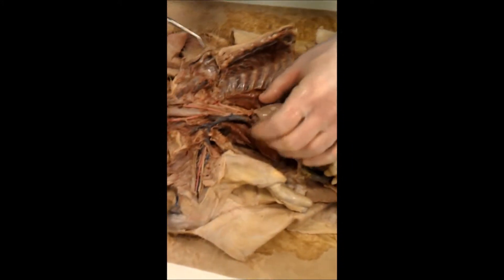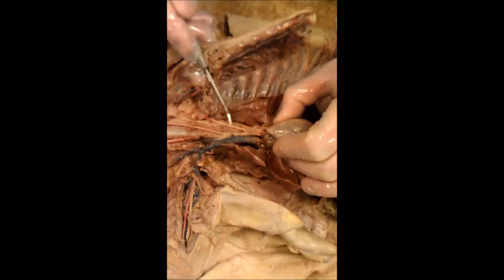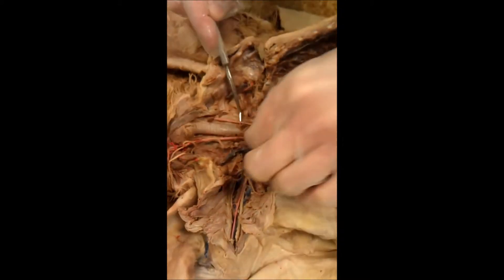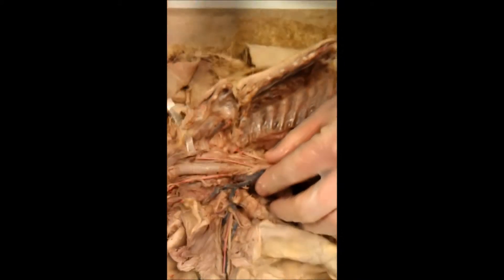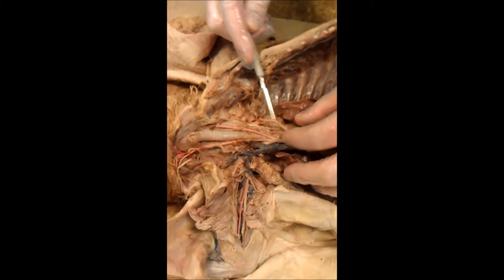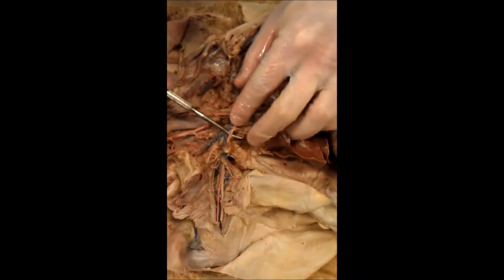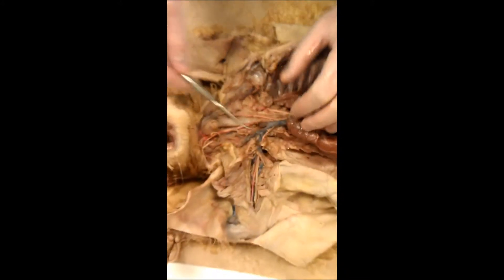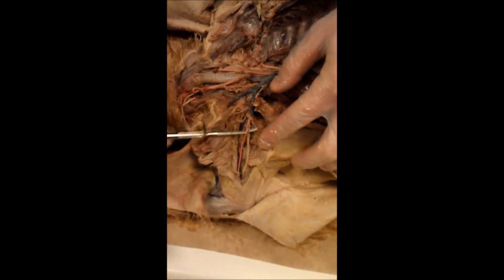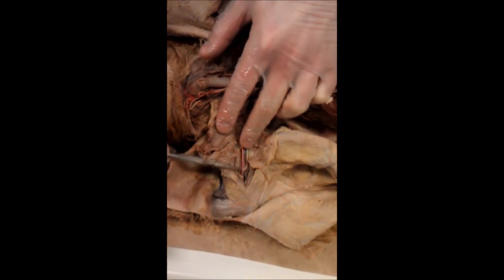The arteries of the cat. Here's the heart, and then here you have the aorta. This is the brachiocephalic. This is the common carotid artery. And then here's the right common carotid. Here you have the subclavian on this side, the left side. And then on the right side, it's kind of tucked under the vein. Here's your subclavian on the right side. Here you have the axillary under the armpit, and then further lateral you have the brachial artery.